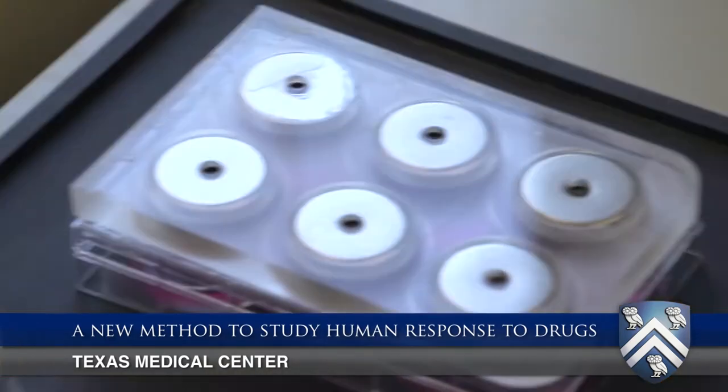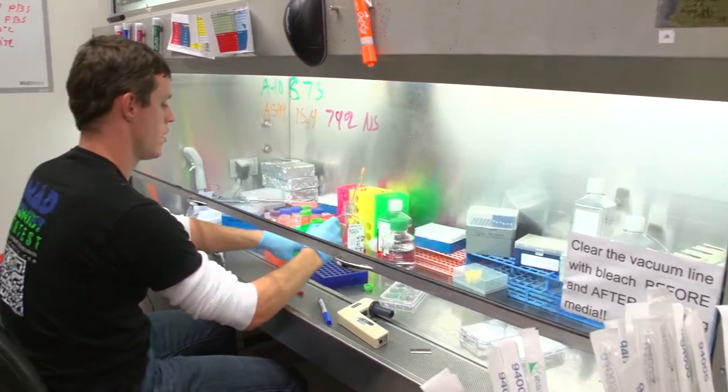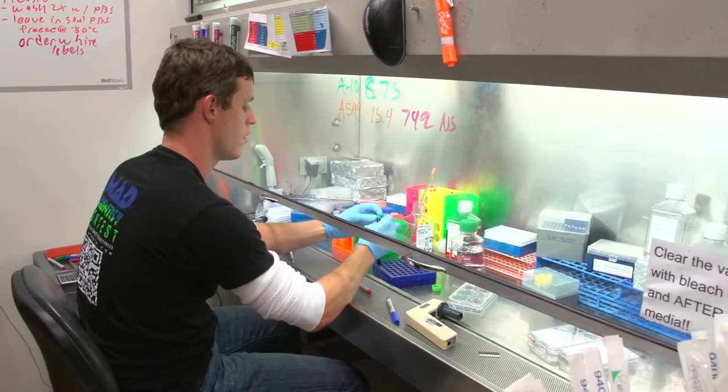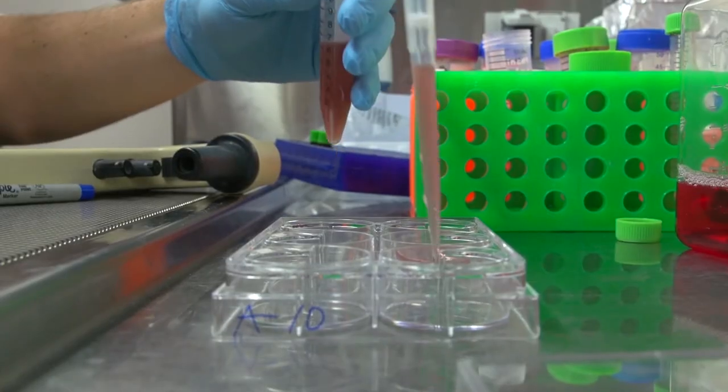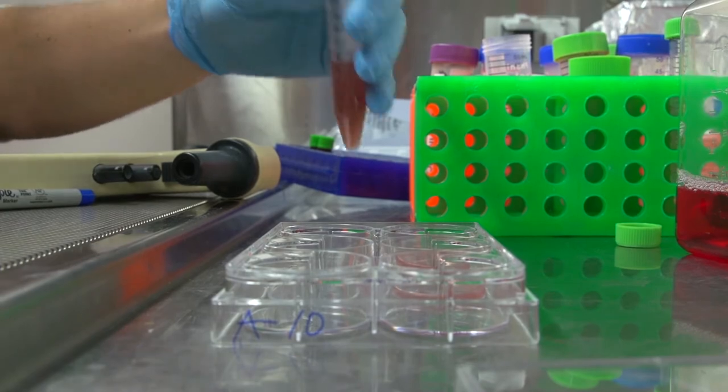At Nano 3D, we use magnetic levitation to create 3D cell culture assays for accurately predicting human response to drugs. We have what we call the nano shuttle, which is a nanoparticle assembly that includes magnetic nanoparticles that we decorate the cells with. It just sticks to the cell electrostatically, and we apply a magnetic field and the cells levitate.